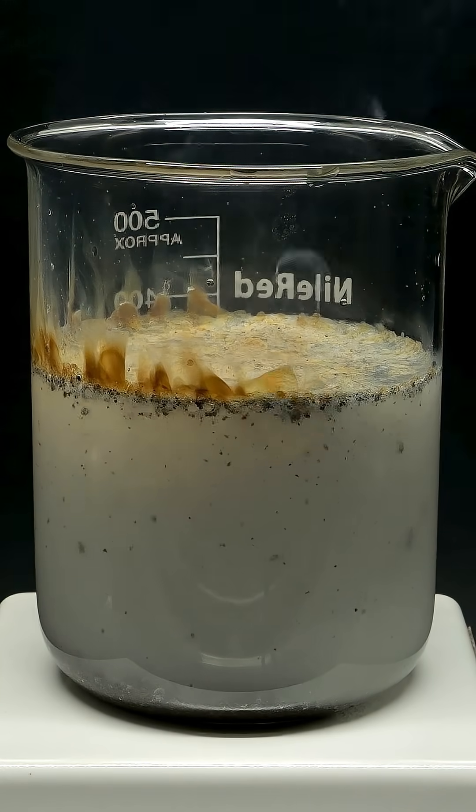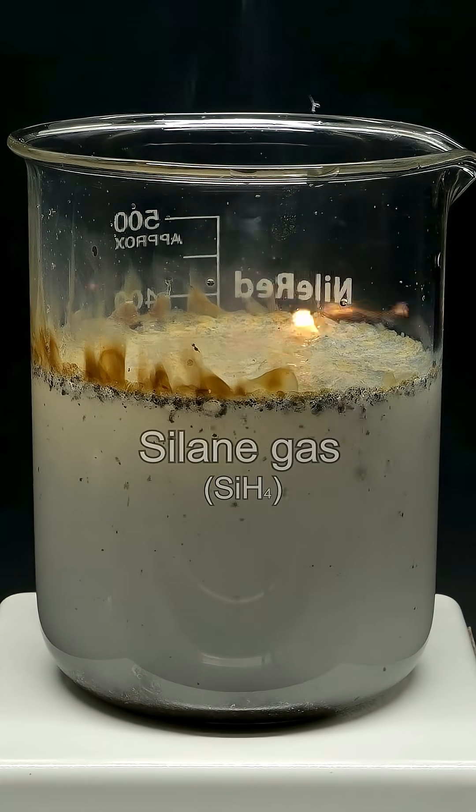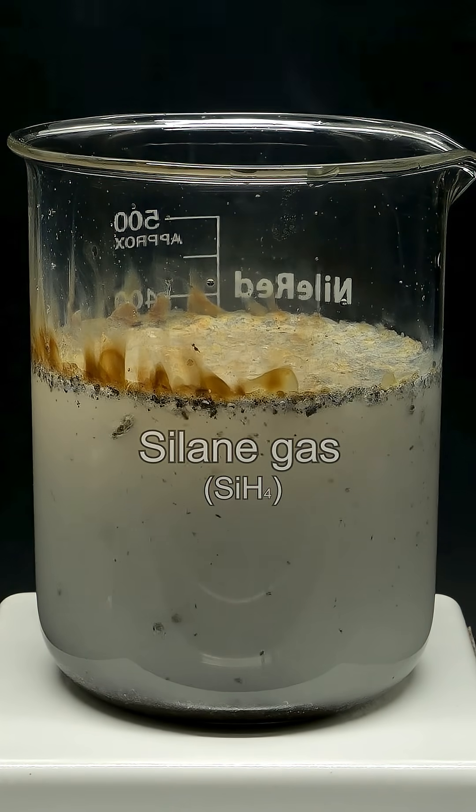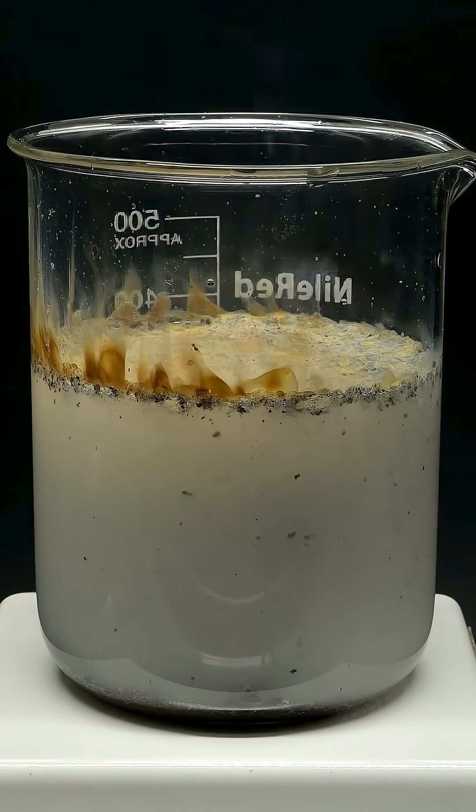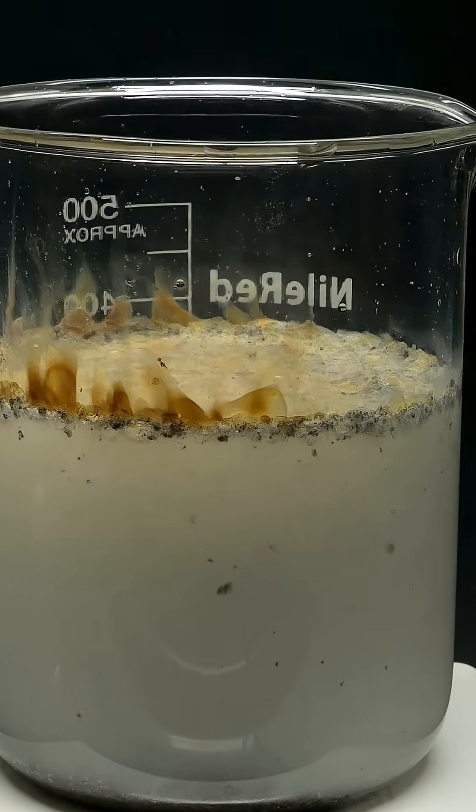This is because all of the magnesium silicide is being turned into silane gas, which is then immediately igniting when it touches air. This reaction doesn't last for very long, but I still think it's pretty cool.